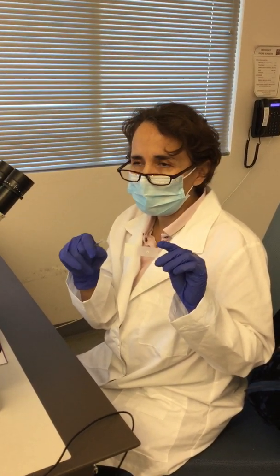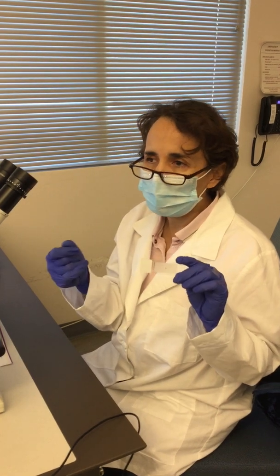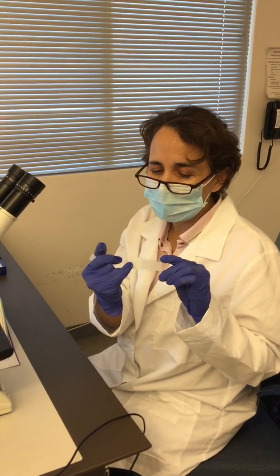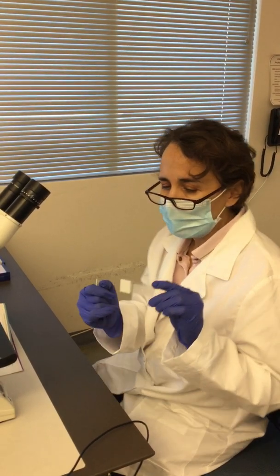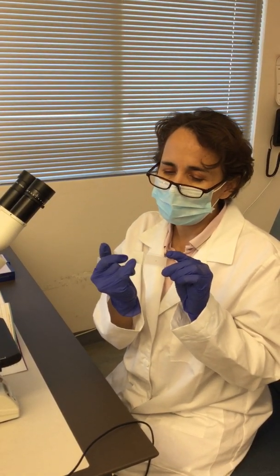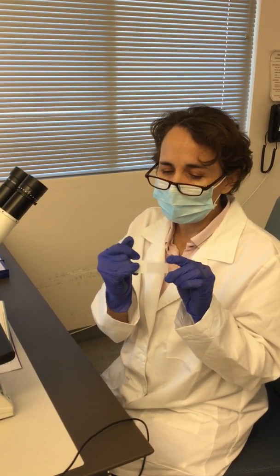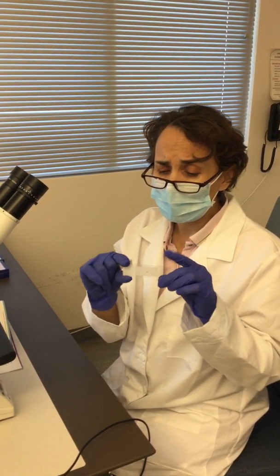Like in the cheek smear experiment done during the cytology lab, you put your name, the date, and the sample name. Whenever you put your name, you don't put your complete name, you just put your initials. That is usually done at the bottom, and then the date, and then you put the name of the sample. So that's what this area is for.